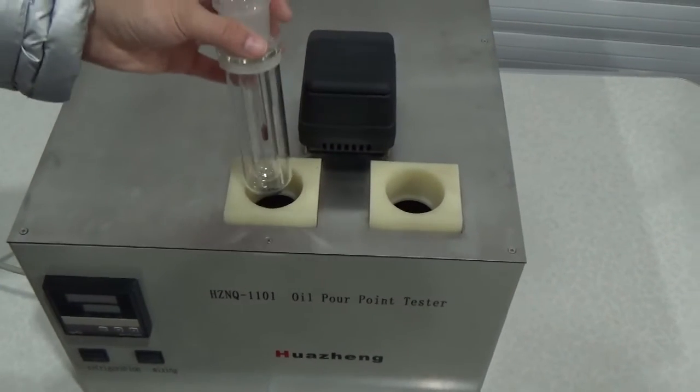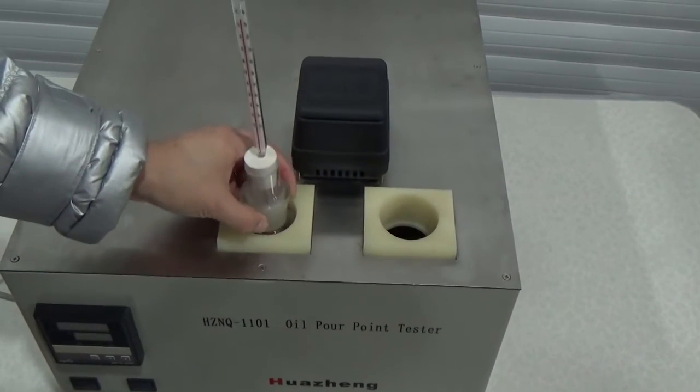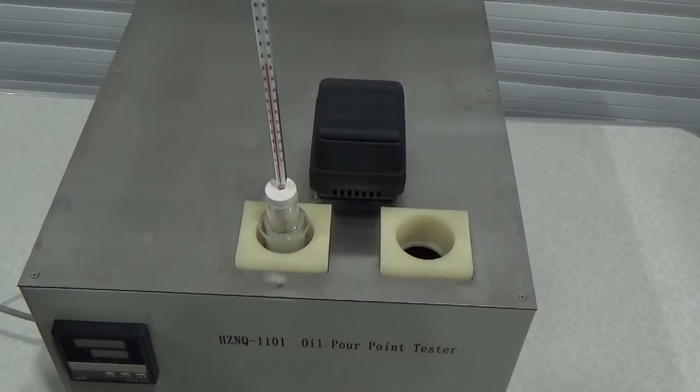Tap the water, and also store the same sample without adding water.